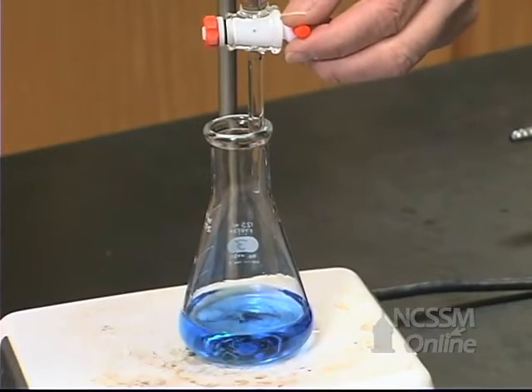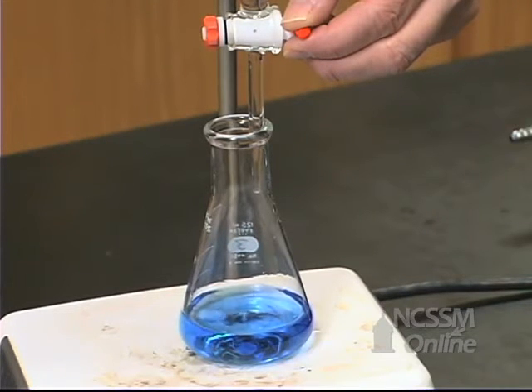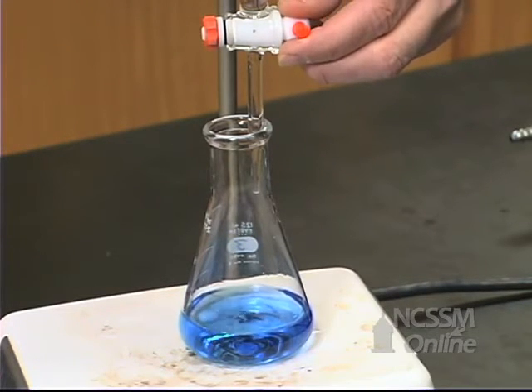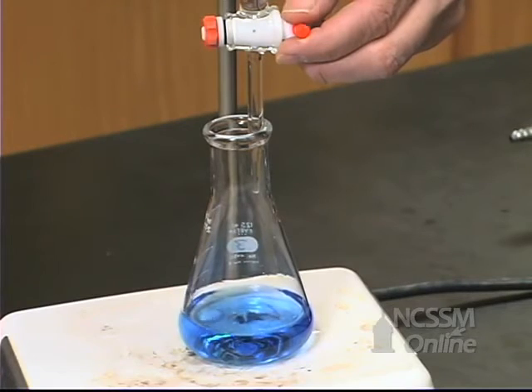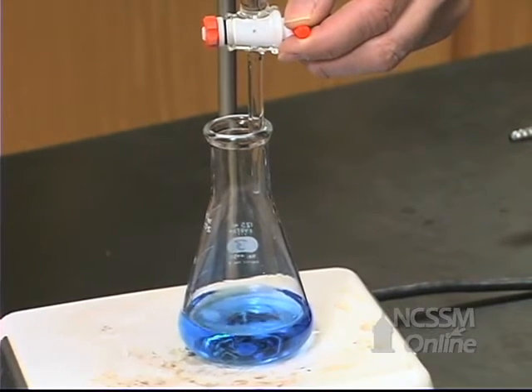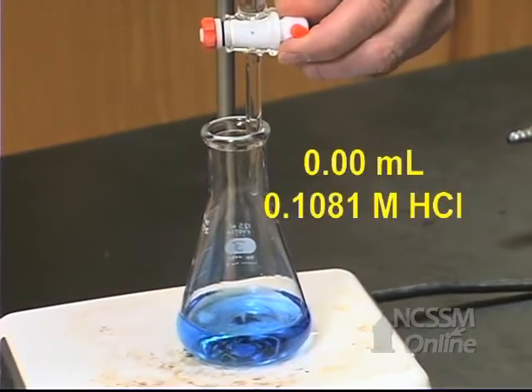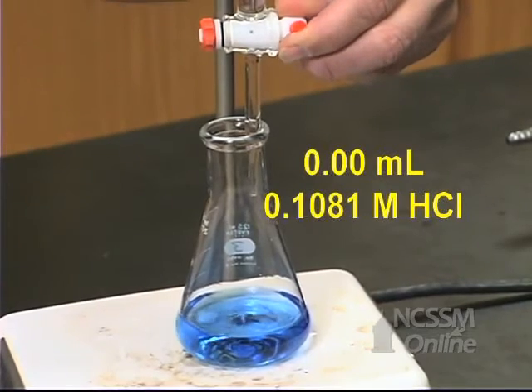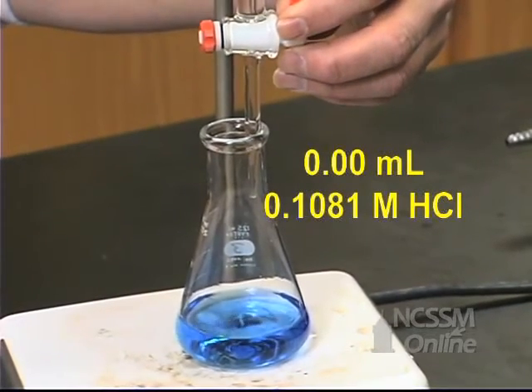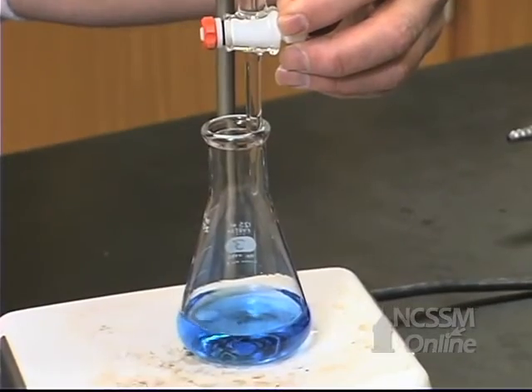We're going to titrate the solution of calcium hydroxide and calcium chloride with a standardized solution of hydrochloric acid. We've taken an initial burette reading. We're going to slowly add the HCl solution until our indicator turns pale yellow.